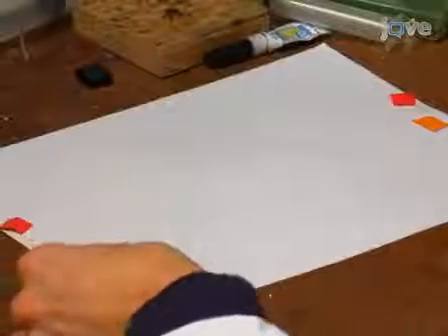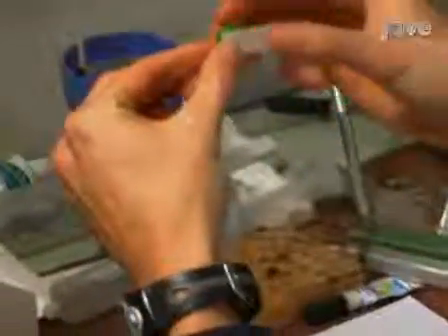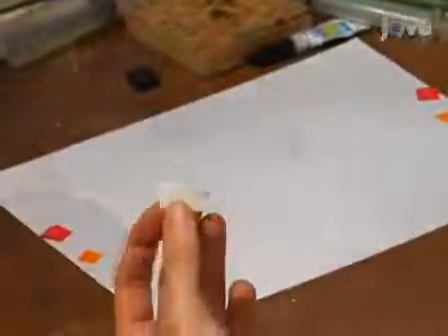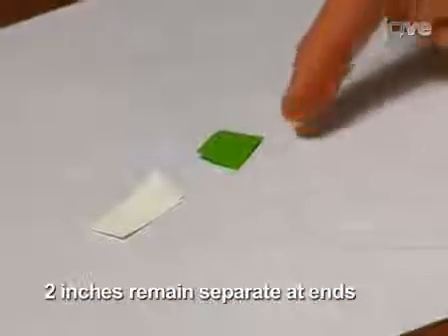Make 4 differential electrodes, using a different color of tape for each differential electrode for identification purposes. Twist 2 of the differential electrodes together, leaving 2 inches untwisted on one end and 1 inch on the other end. Repeat with the remaining pair of differential electrodes.